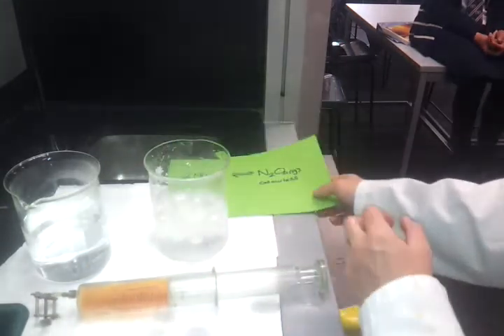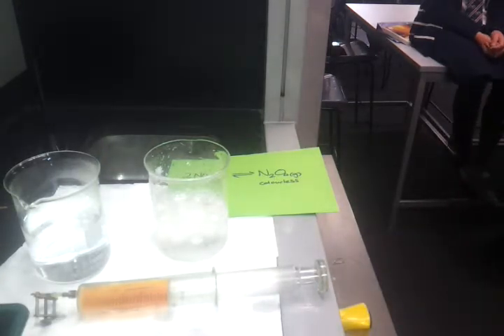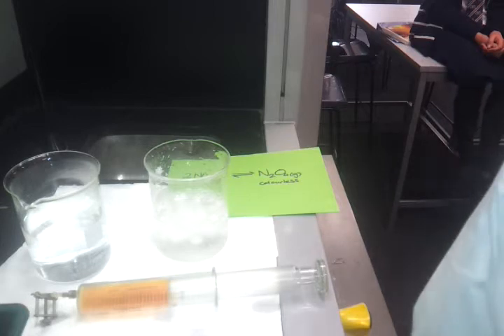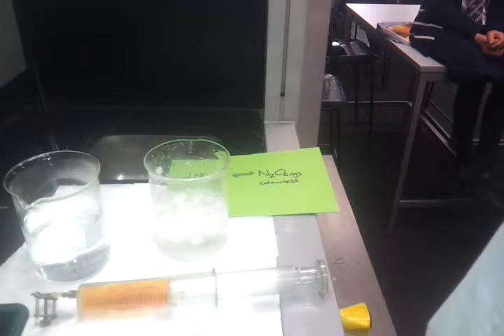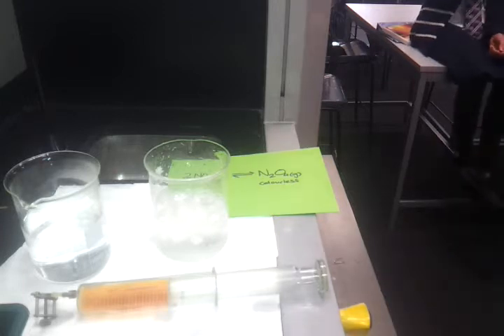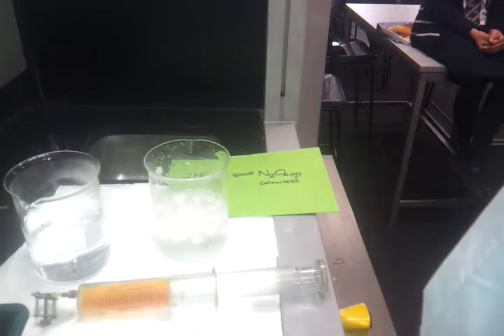When we put it in iced water, the colour faded, so we went towards N2O4. That means the forward reaction is what? Exothermic or endothermic? I've cooled it down, it's going to try and what? Heat it up or cool it down more? It's going to try and heat it up to overcome what I've done. I've tried to change something, it wants to stop me doing that. So by cooling it down, it wants to heat itself up.